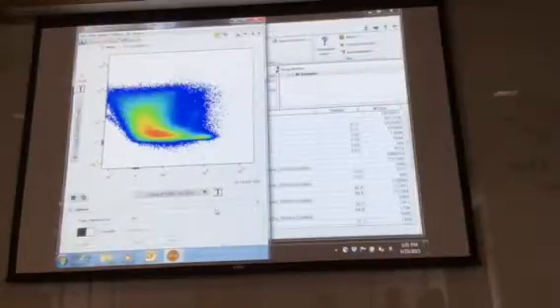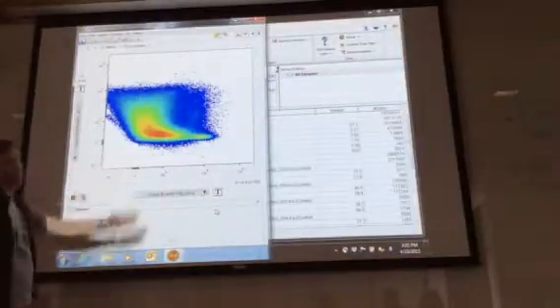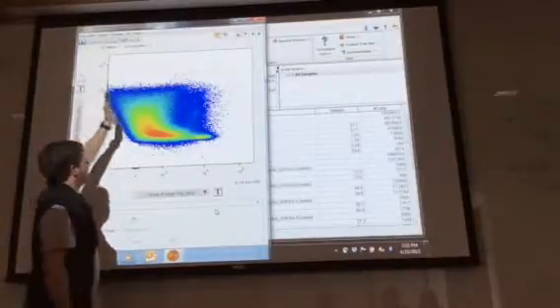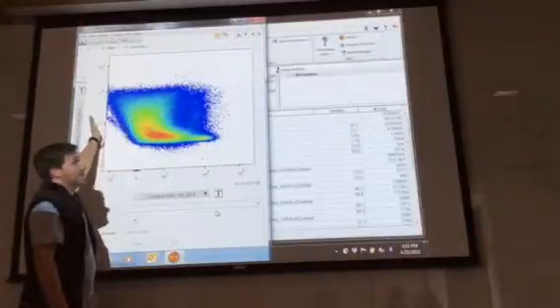So then how do I compensate it correctly? So what is the goal of compensation? The goal of compensation is that, if you were going to put in a positive or negative population in the case of this example, you said, okay, well I'm going to put the positive and negative cutoff here. So then anything that's over this side is negative.